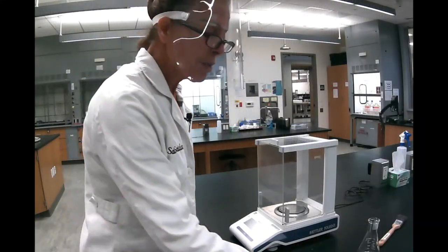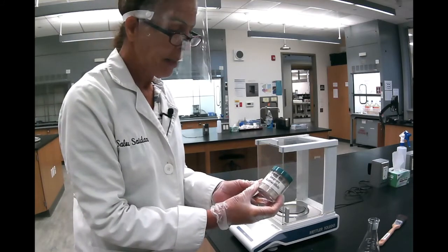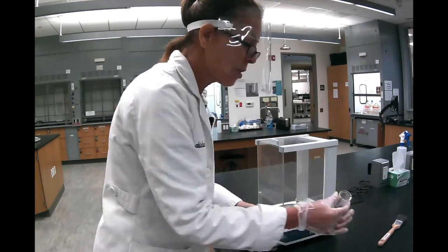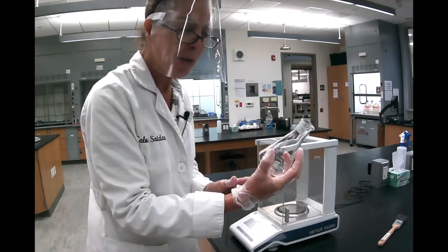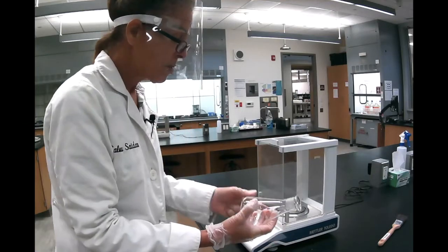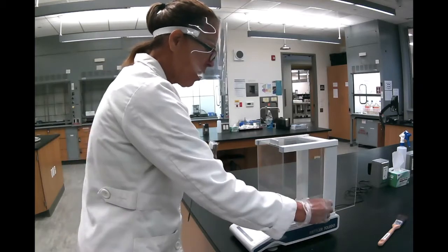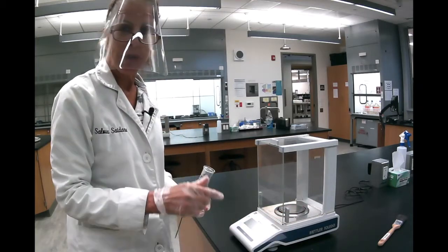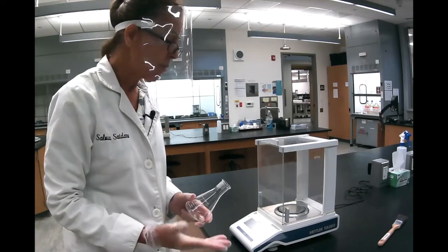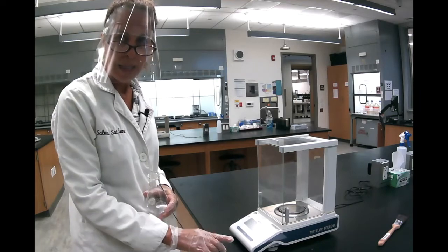So today we're going to do the recrystallization of an impure acetanilide. The procedure says to use a 250 milliliter Erlenmeyer flask and to weigh about 1 gram. So let's repeat, how do we use an analytical balance? It's always a good idea to never tare the balance. It's always best to do measuring by subtracting. So you see my balance is reading exactly 0 now.